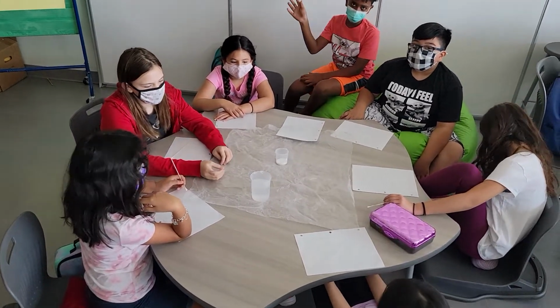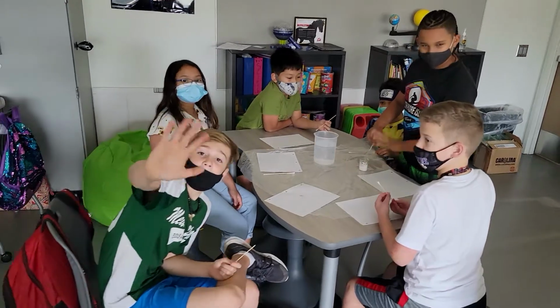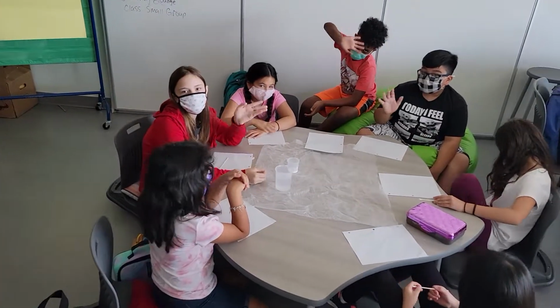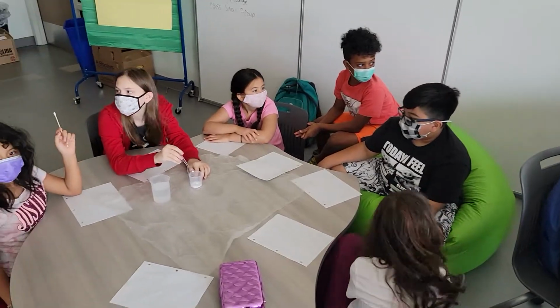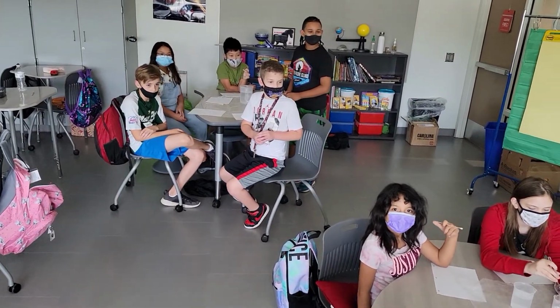Now, while we are waiting for our first paper to dry, we have now dispersed into our lab groups. There we go. We have group 1, we have group 2, and we also have group 3. Now, the same process that was shown at the beginning of the video will also be done right now in this session. All cell phones supposed to be on silent, right? Oh, yes. Yes, all of them.